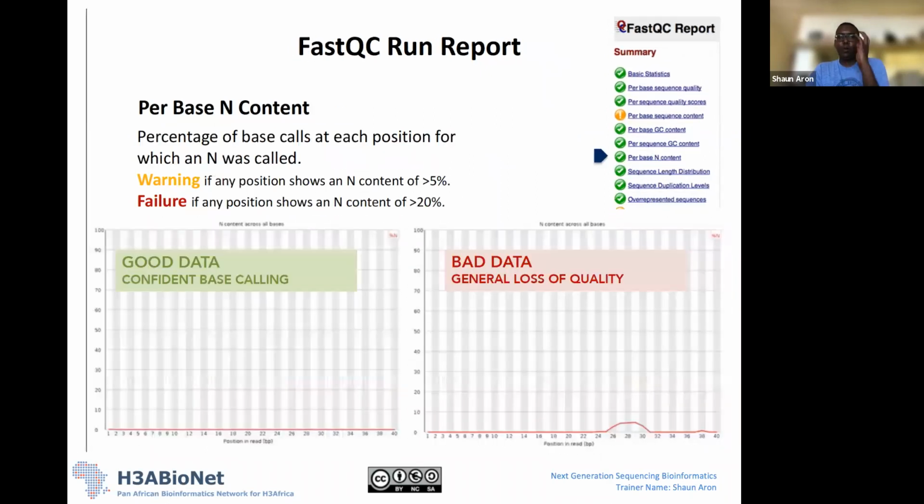Okay. So the next metric that we're going to look at is per base N content. So this is again looking across all your reads at each position, and it's identifying if there are any Ns in our reads. Ns in the read are basically where the instrument has not called a base. So it was unable to call a base at that position, so it inserts an N in our read. Essentially, what we want to see is minimal amounts of N in our data. At any position, we don't want to have lots of Ns.